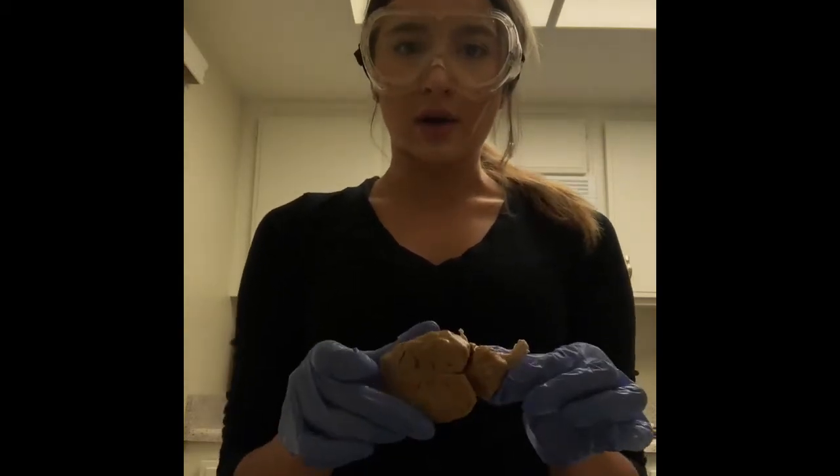It is the week 7 video exercise, the gross anatomy of the central nervous system. Today I will be dissecting a sheep's brain and pointing out and labeling each of the structures on the sheep's brain. I have already washed my sheep's brain, so now we will start pointing out all the structures.